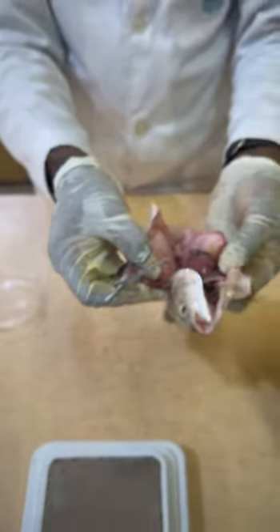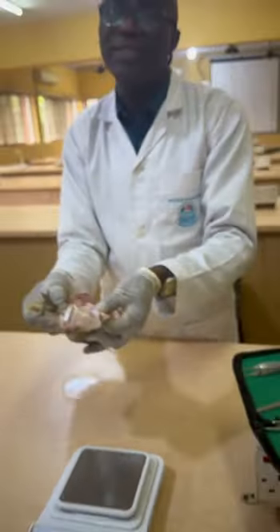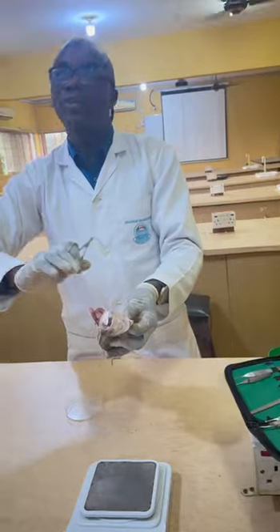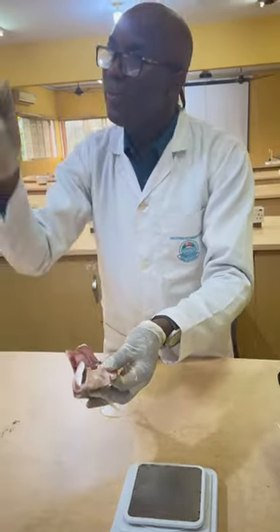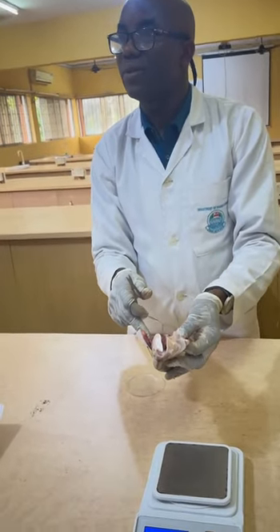Immature means, because I don't want to assume for now that it is resting. Do you understand? It is when you go back and check literature. That's why it's always good to start with few, so that you will be able to correct whatever along the way. So for something like that, you go back to literature. What is the maximum size? So either immature or at resting stage, that's what I can place this fish.